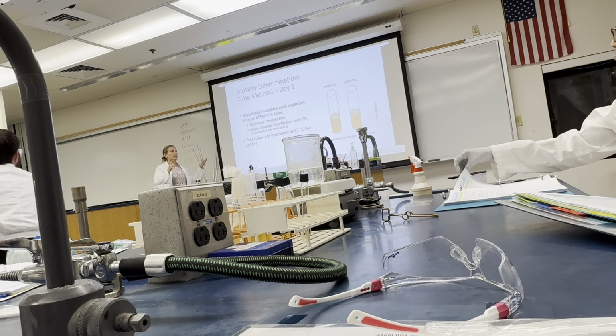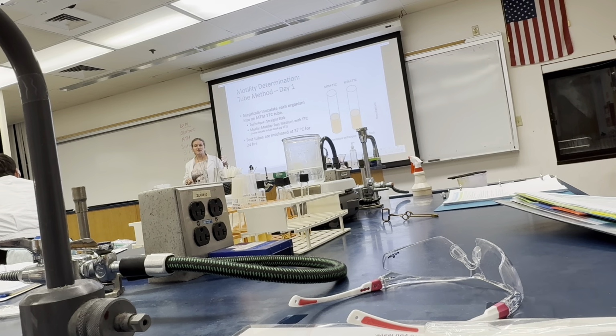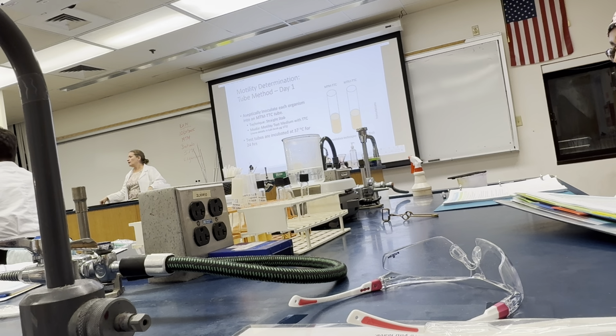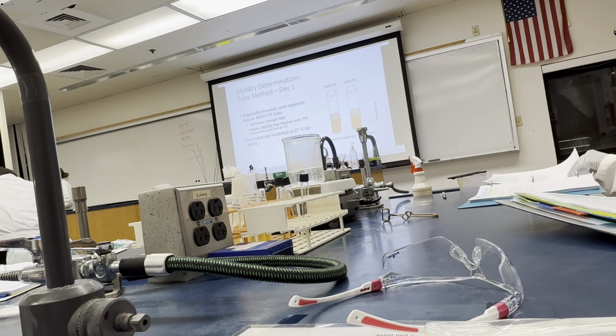The benefit of the wet mount, doing the dark field wet mount, is that we get immediate results. So that's the pro. The con is that whether they're motile or not, you will see movement, so you have to be able to differentiate between true motility and Brownian motion. The tube method with the motility test medium: the pro is it's easier to read. The con is you have to wait for incubation. Questions on this one? Okay.